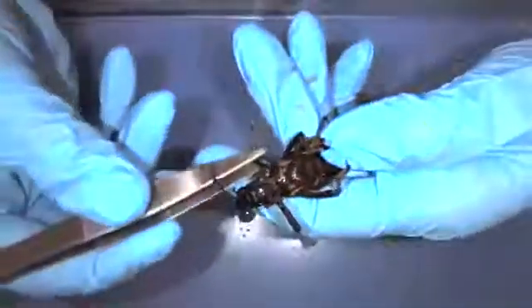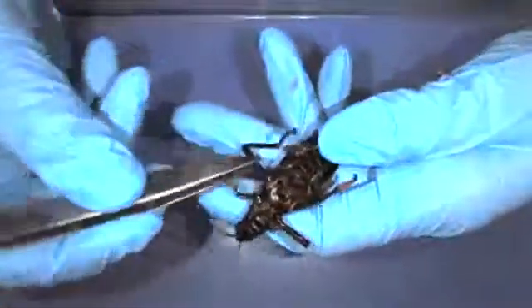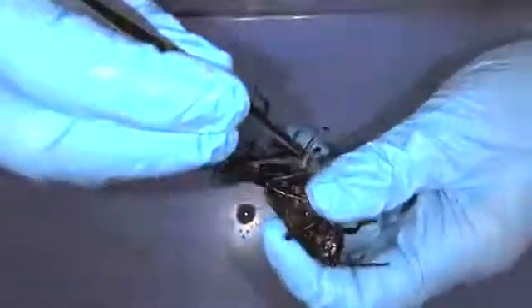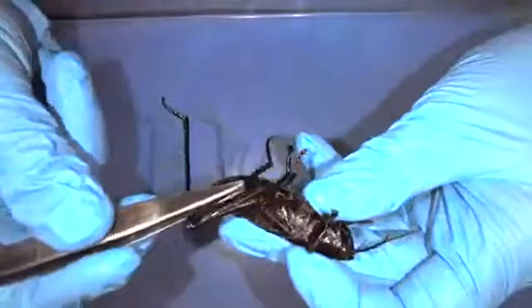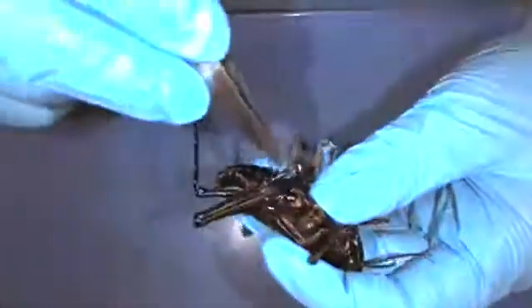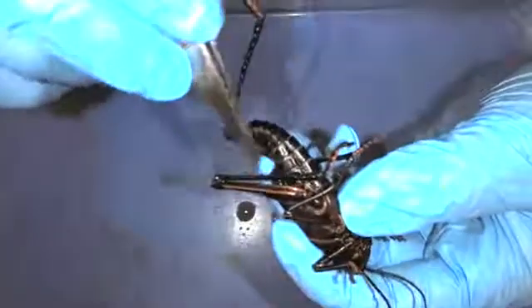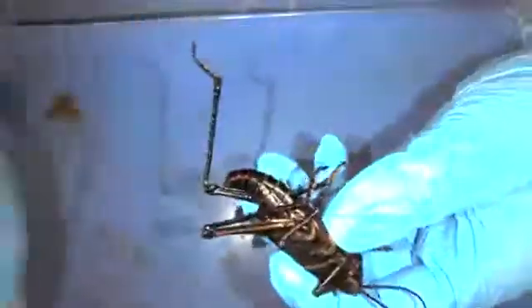In the thorax they have kind of three sections, and for each section they have a pair of legs. You can see there's a front pair of legs here, a medial pair of legs right here in the middle, and then these back legs are a lot larger — this is what really helps keep them mobile and jump around. Each of those legs has tiny little spikes that stick off the end.